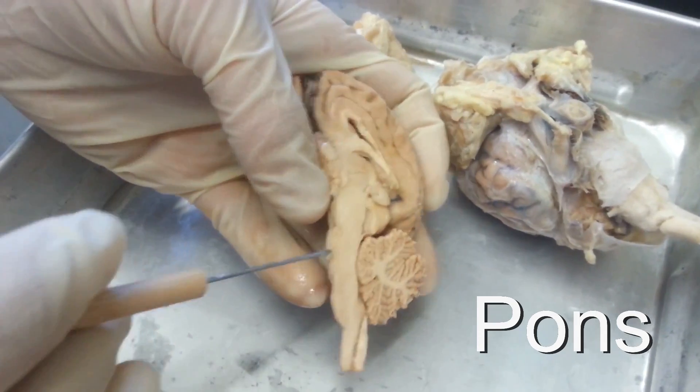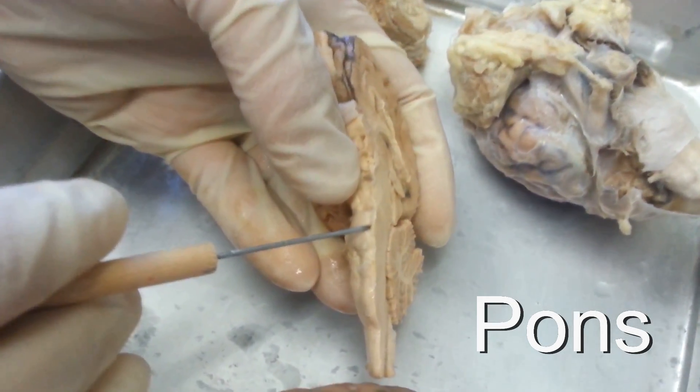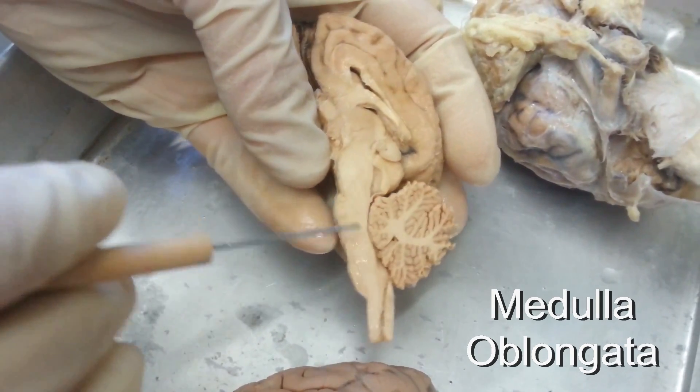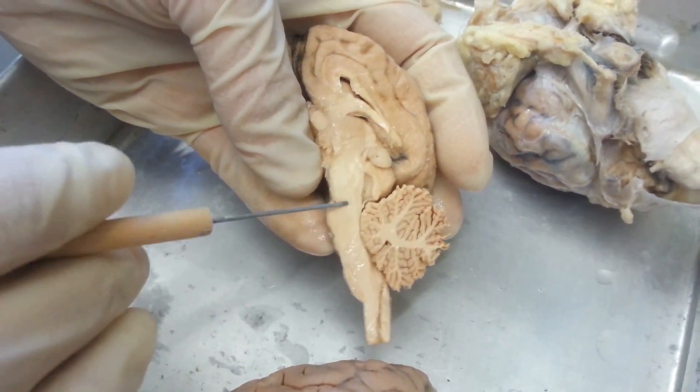When you get to the brainstem, you have the pons, which is this raised portion here, and the medulla oblongata is this region here.